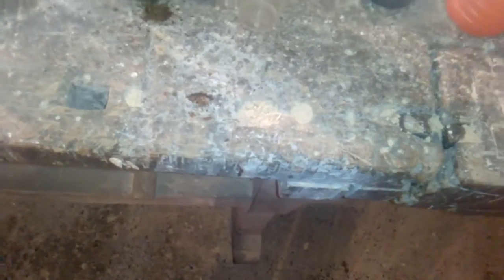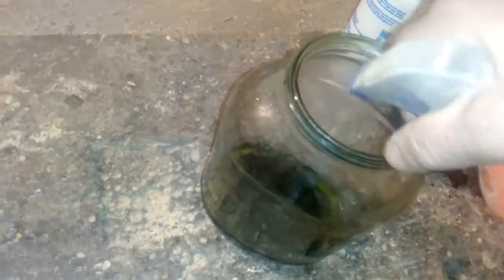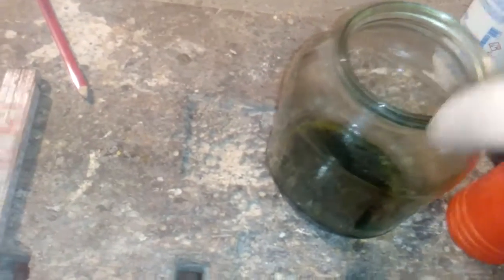Now I will show you one trick. You get your spray bottle — the twister — with more water. Put it in the HCL. Okay, now you concentrate all the black sand and the gold to the bottom. Just spray it, so everything will be in the solution.